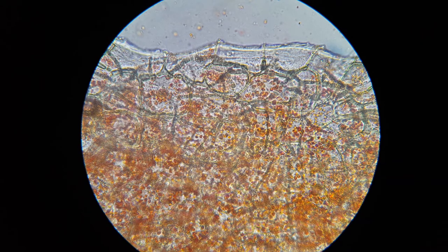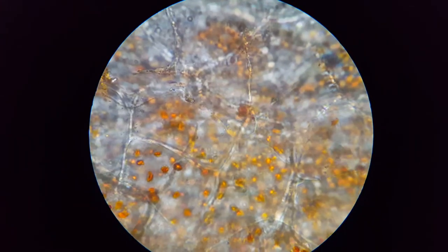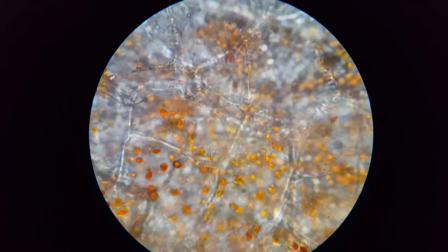Now we're looking at it at 400x magnification. I'm going to switch over to 100x, which means I need to drop a little oil on here. Now I need to get it into focus again. With the oil on there and the wet mount, it kind of messes up your ability to focus a little bit.